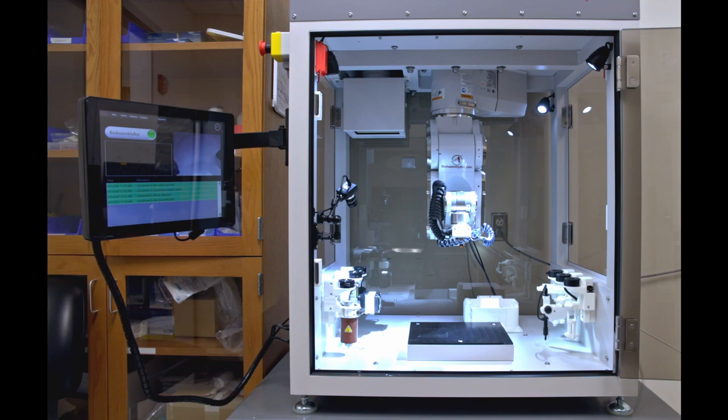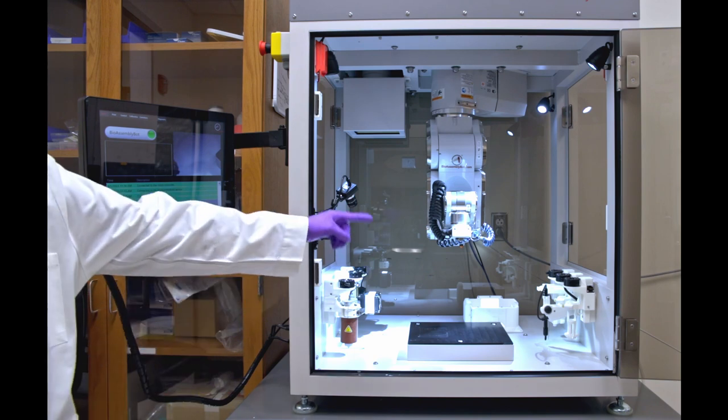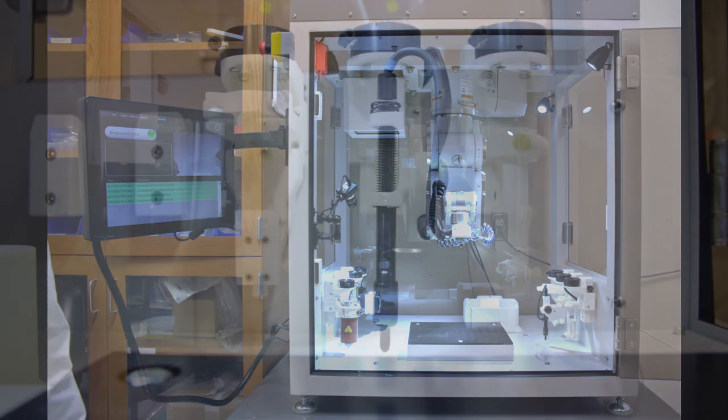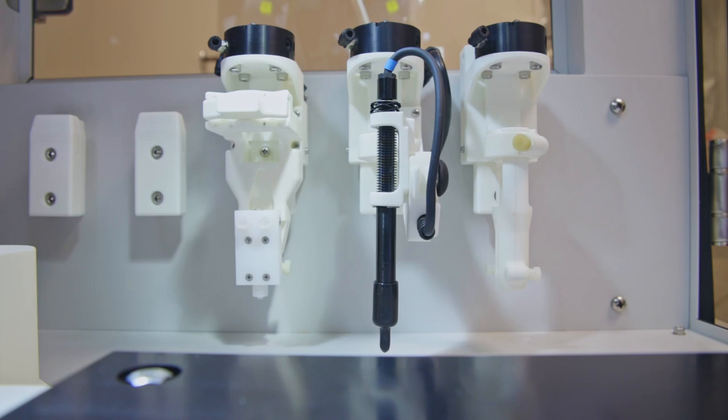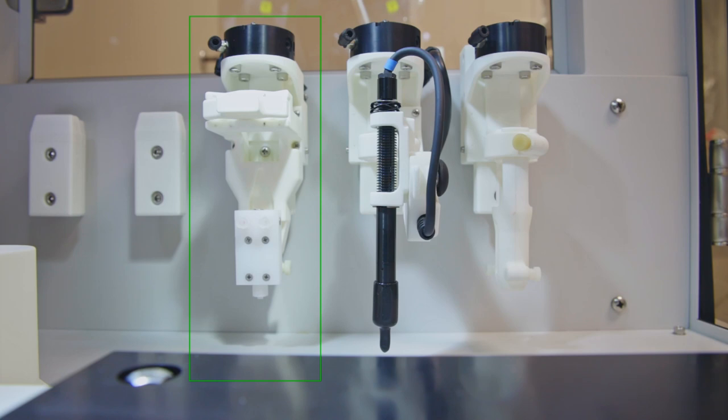The air compressor can provide pressures up to 60 psi. The robotic arm can pick one of these six printheads. We have ambient temperature printhead, a UV printhead, and a dual extrusion printhead. The dual extrusion printhead can accommodate two different materials at the same time. Different pressures can be applied to individual materials for mixing at varying ratios.